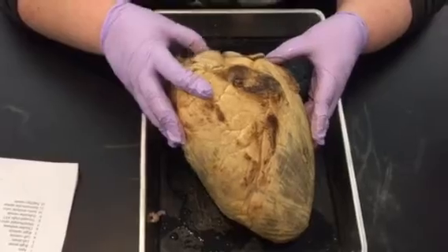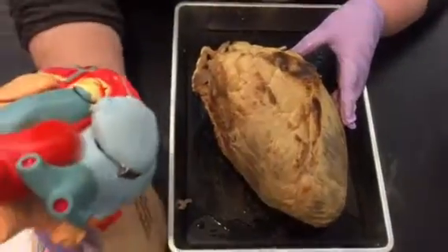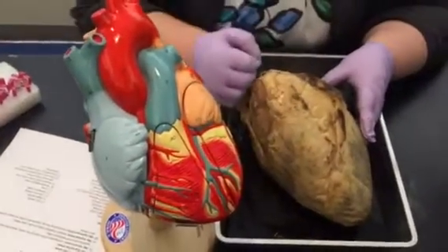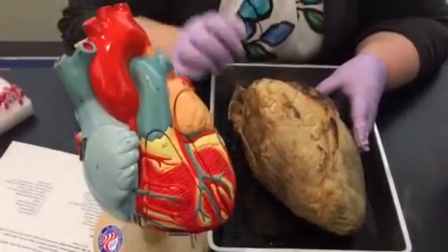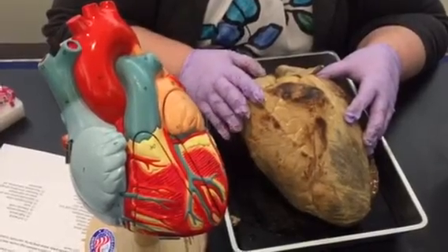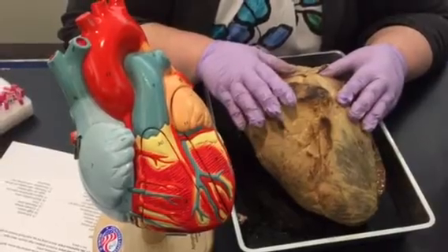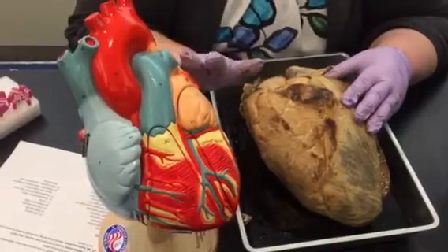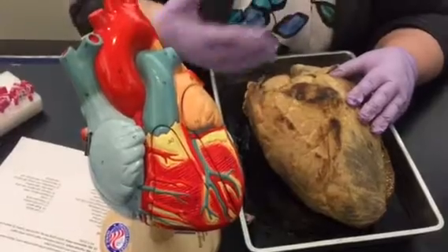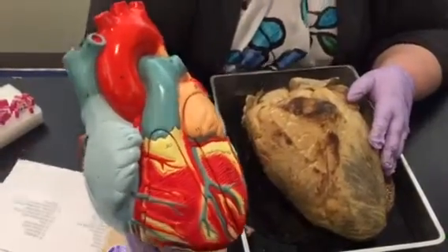You can see in a lot of the hearts the pulmonary trunk, which is this big blue vessel, and the aorta. Not as easy to see in this particular heart, but you can see it in other hearts. I'll put the model out with that part pointed to it so you can see the comparisons — if you know it on the model, you can find it on the real heart.